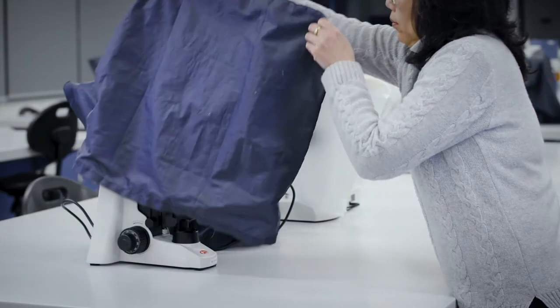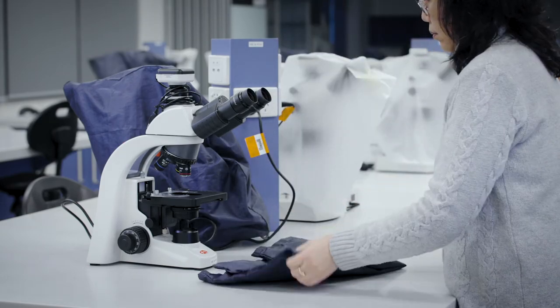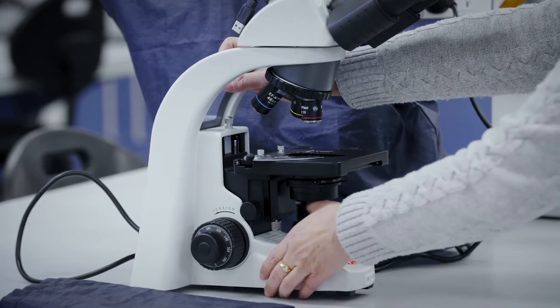To begin, remove the cover from the microscope. Be aware that the microscope is heavy. Hold the microscope with one hand on the handle and the other hand on the base.